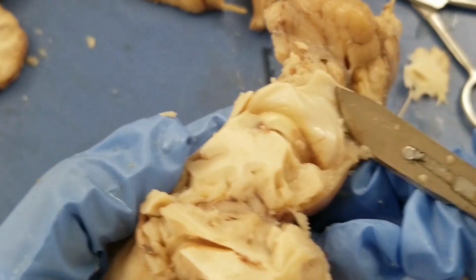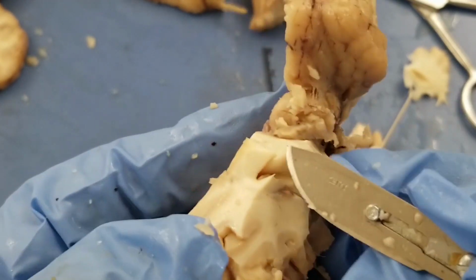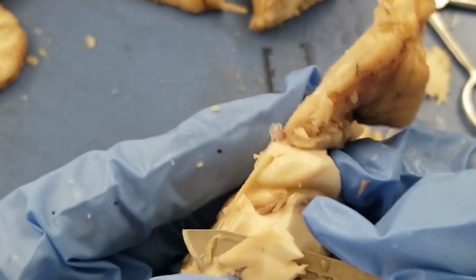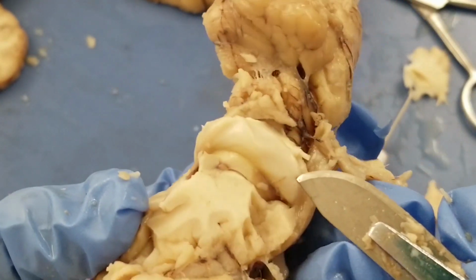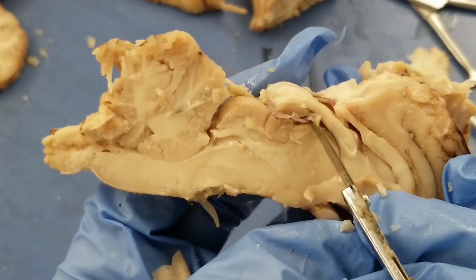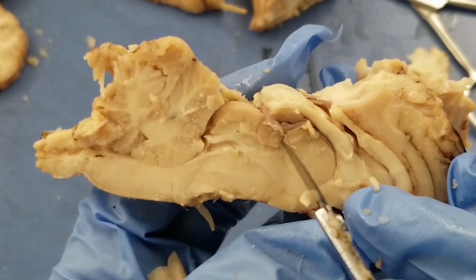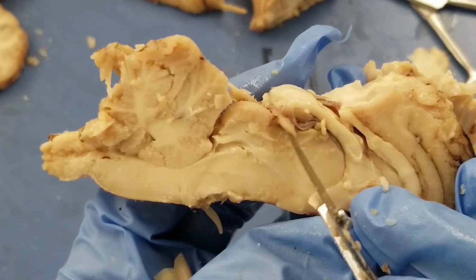You see that? See that hippocampus wraps around the brain. And from the mid-sagittal view, early on you only see a very small part of the hippocampus in here. And underneath that, that's your pineal gland.